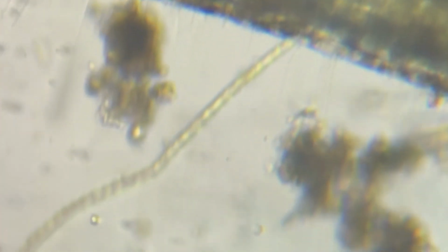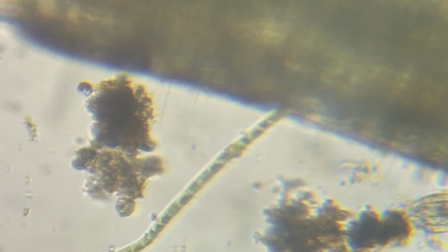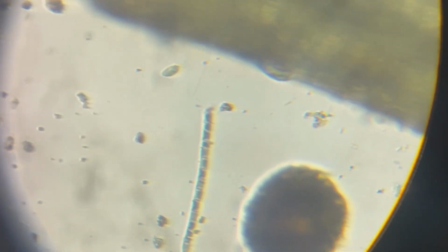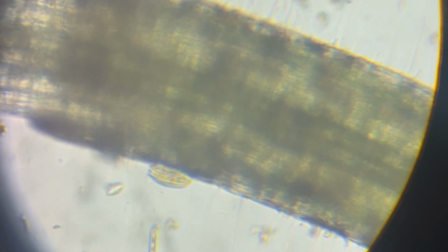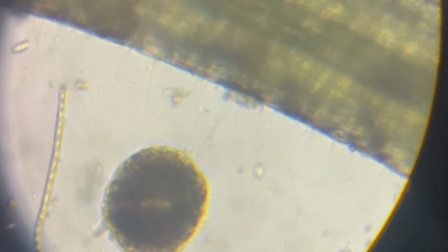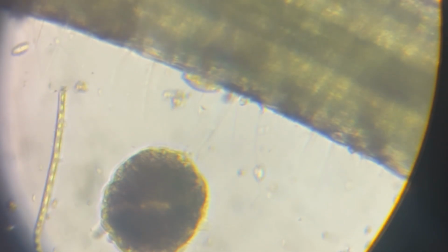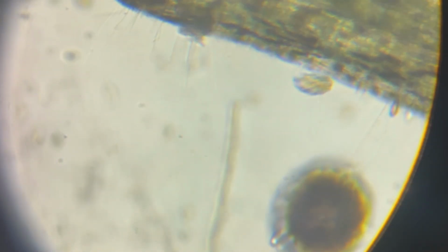Now as we zoom in closer here, in the red circle you'll be able to see root hair cells who've got a vital job of absorbing that water that's needed for photosynthesis. And you can see as it comes into focus here, just along where that red circle was, the root hair cells. Interestingly enough, when we saw the root hair cells, we managed to find a rotifer. Now, a rotifer is a microscopic aquatic animal measuring between 0.1 to 0.5 millimeter in length. That's around 100 micrometers to 500 micrometers.